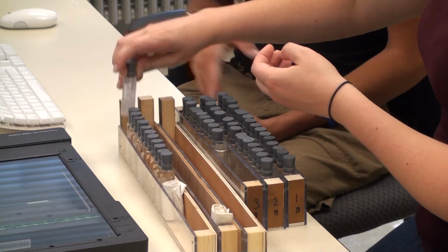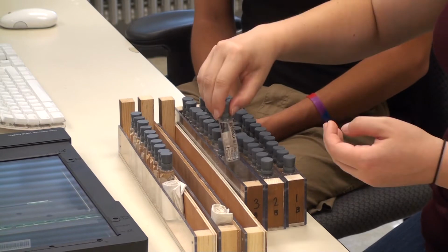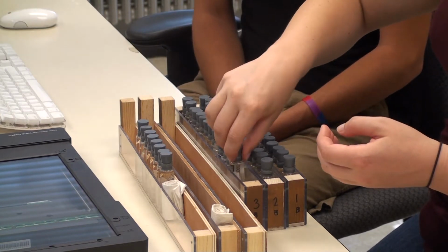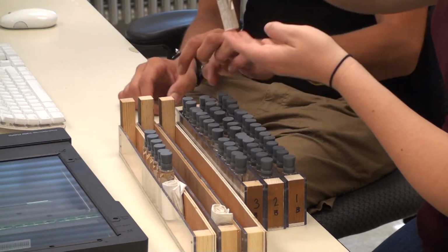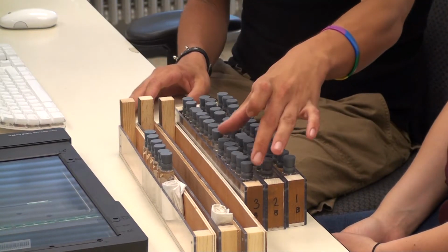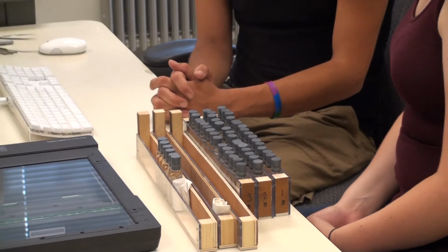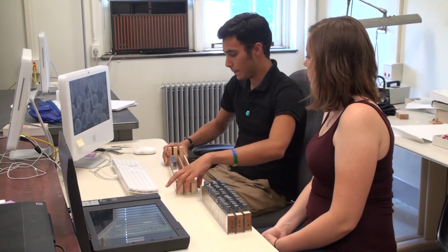Now sometimes this will cut off the last few vials in a rack series. That's okay. Just start your next set of images using your final rack and indicate that somehow. It might be best, depending on how many are left in a rack, that rather than filling up your third imaging rack with a partial of the next rack, you might end up just leaving it out and filling it in with spacers. In this case, it's about half and half, and if you just start the next one with it, it should be easy enough to figure out. So you can make that judgment as you go. All right, well, we're ready to start imaging.